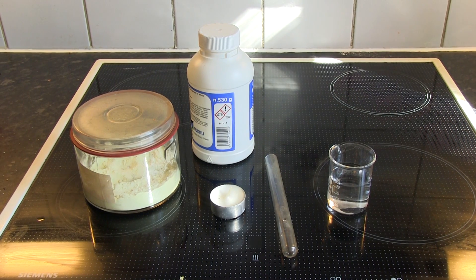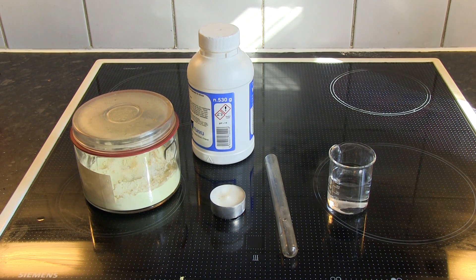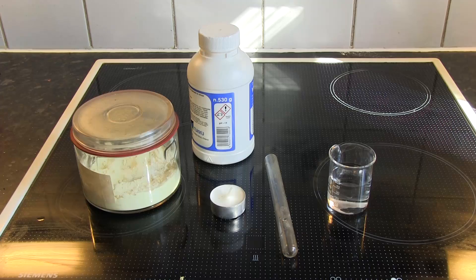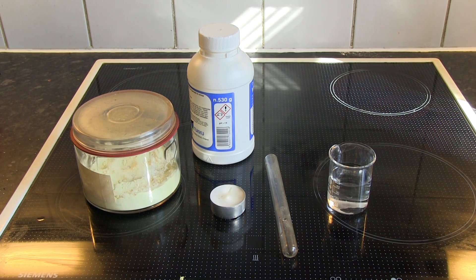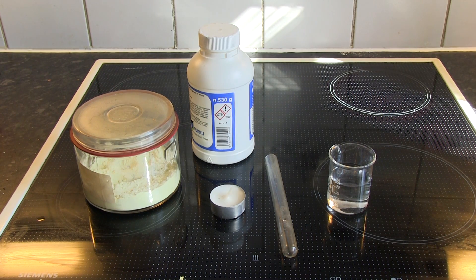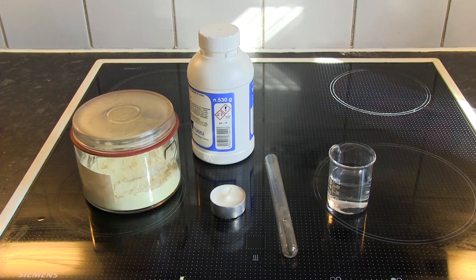Sulfur doesn't dissolve in water, so cleaning sulfur from your previous experiments may be a pain in the ass. But there is a solution, and the solution is alkaline metal hydroxides.